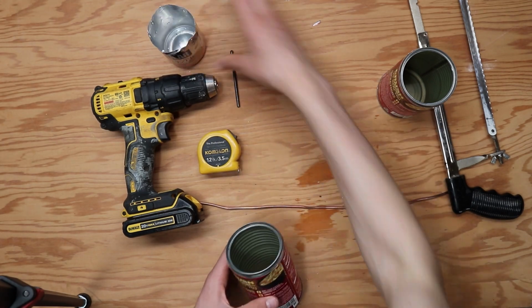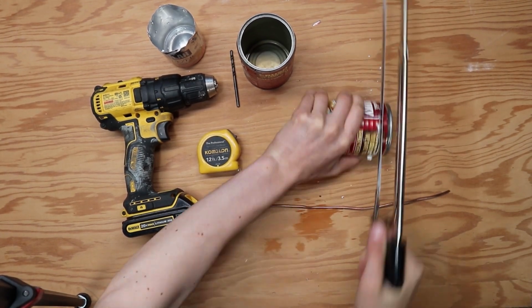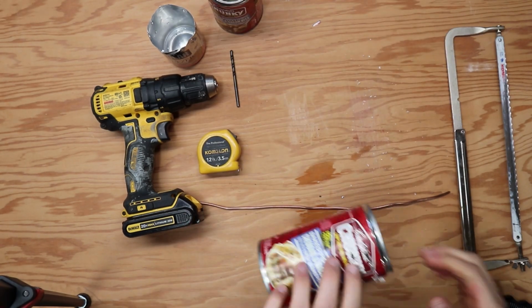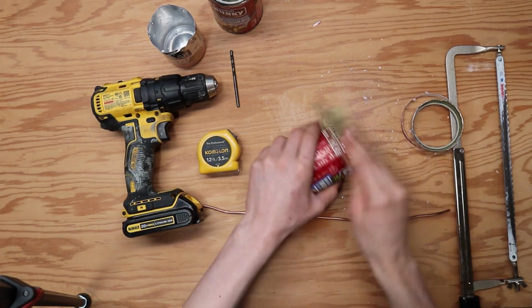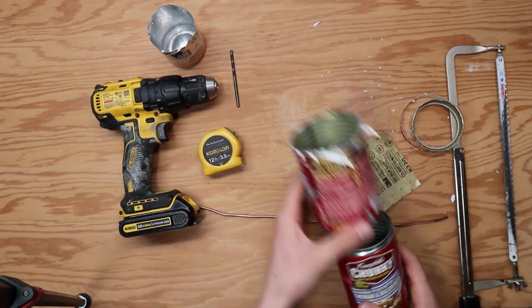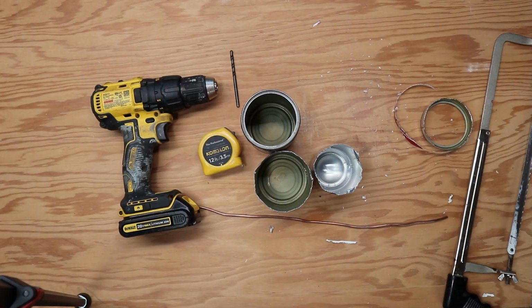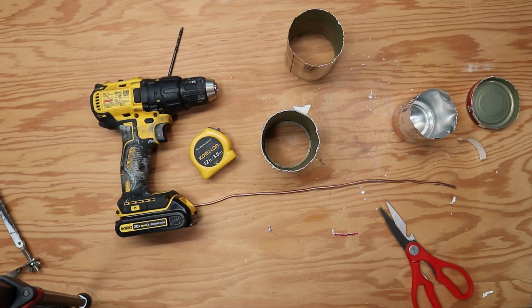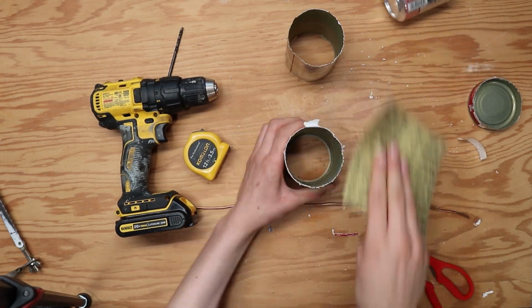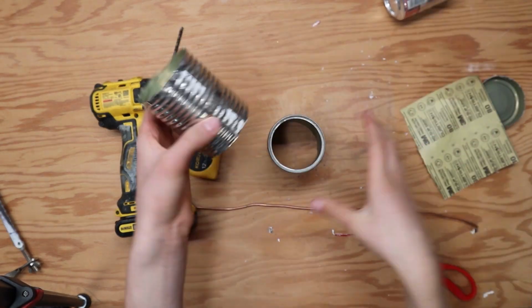The first thing we're going to do is cut the top and bottom off of one of the cans. I'm going to do a little video work and do some fast forwarding right here. If you have a Dremel tool or similar with a cutoff wheel, you can go ahead and use that. It will be a lot faster. Once you get the top cut off, go ahead and smooth it out with some sandpaper like we did on the other one. Repeat this process on the bottom of this can as well as the bottom of the other can. Do not cut the top off of one of the cans.